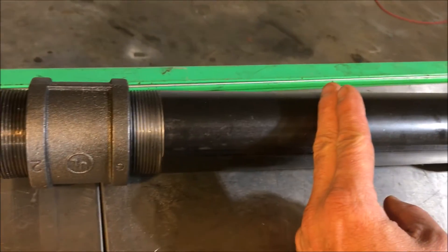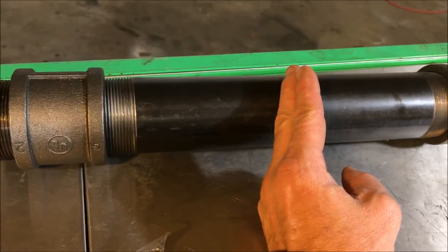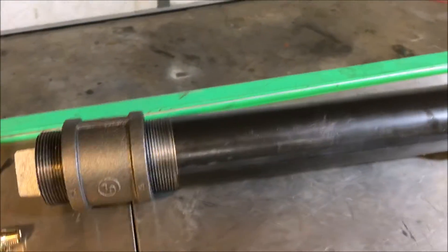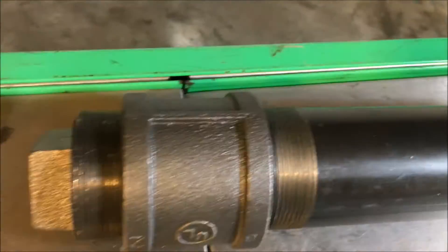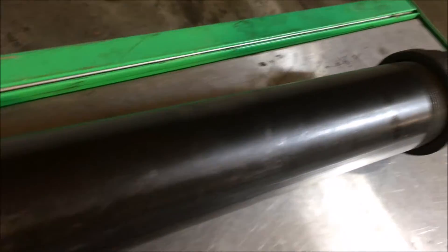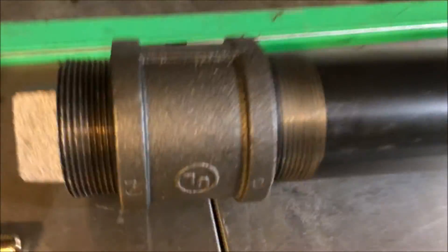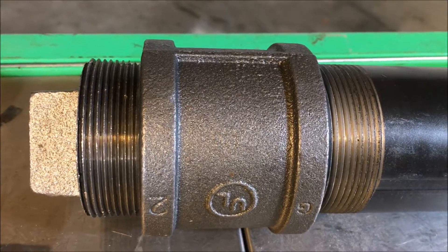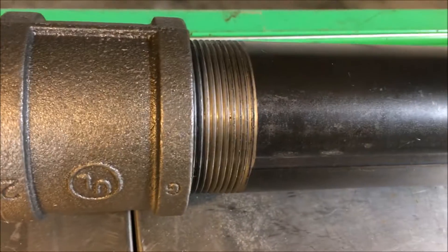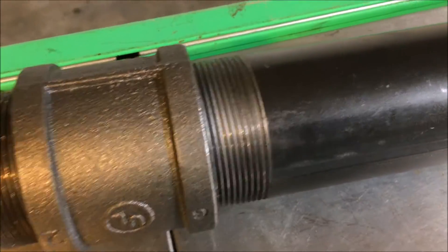If I drain that once the pressure is built up, that will alleviate some of the air contamination issues. I also have a vacuum pump I could use, but I'm not going to get all crazy like that. I'm just going to avoid igniting anything, purge it, and let the gas vent for a while until the reaction gets going good. I'm not sure what I'm going to do about runaway reaction — this particular reaction is very prone to runaway.